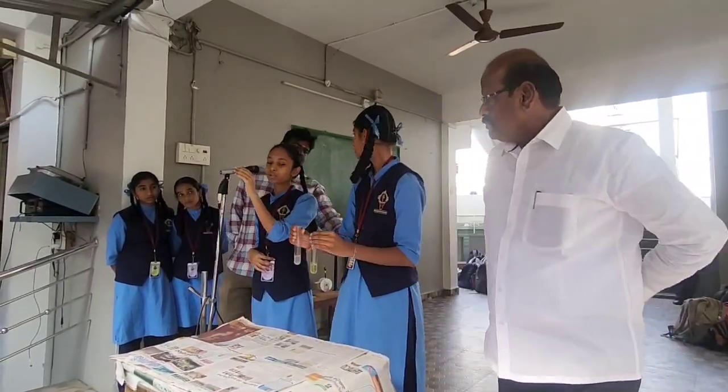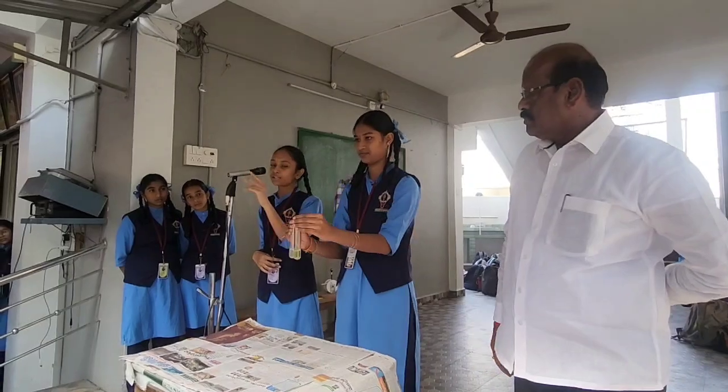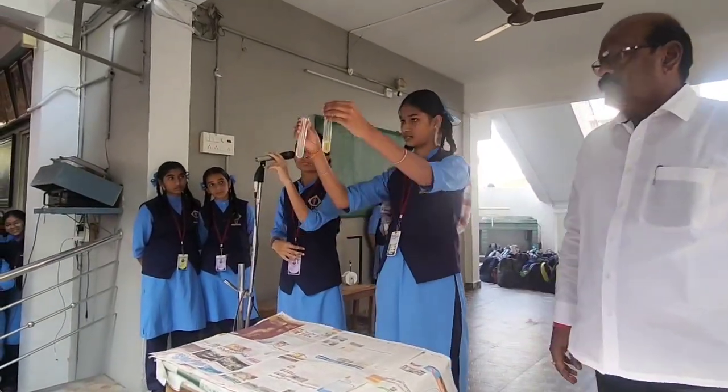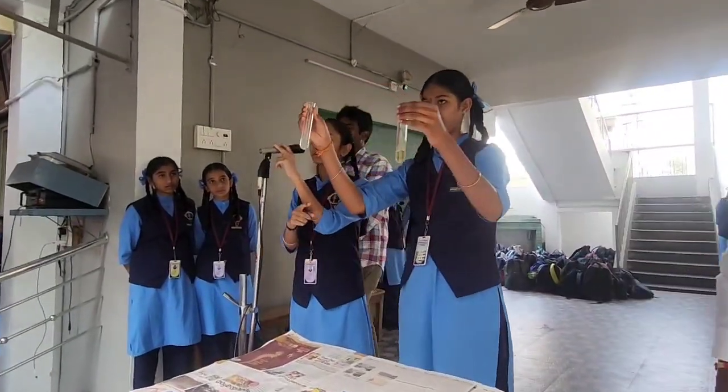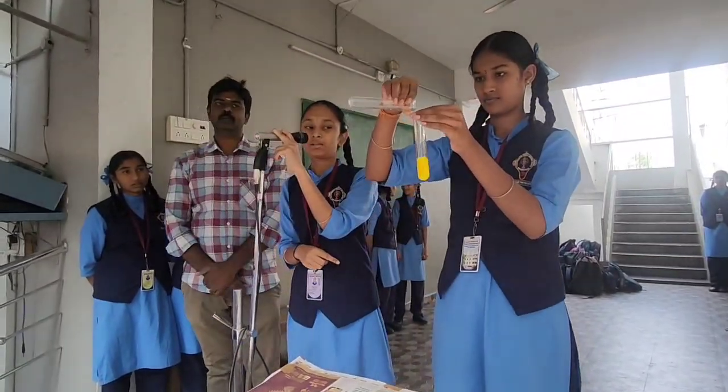We took two solutions of potassium iodide and lead nitrate in two test tubes. And when we mix it, just observe what happens.